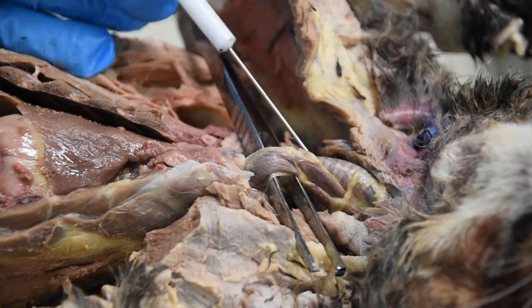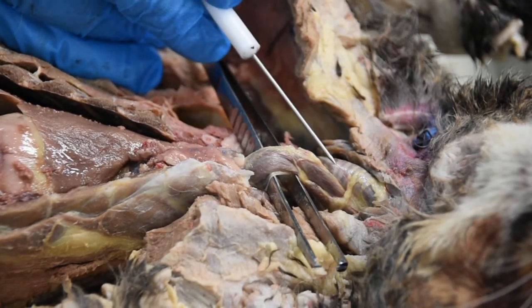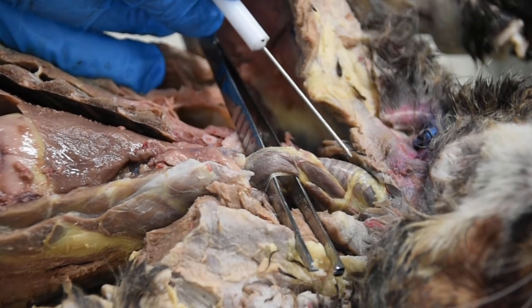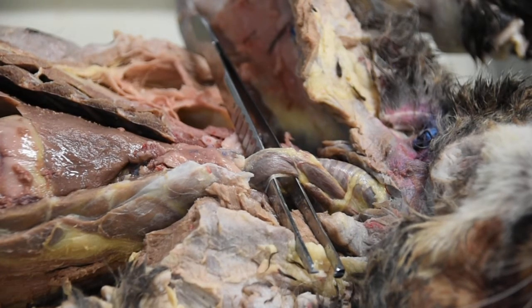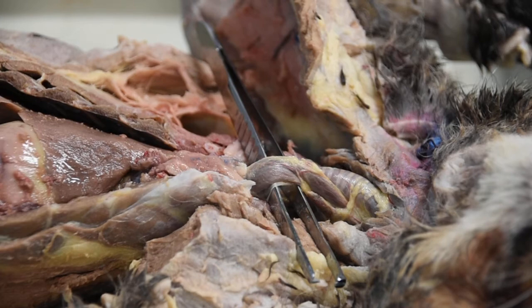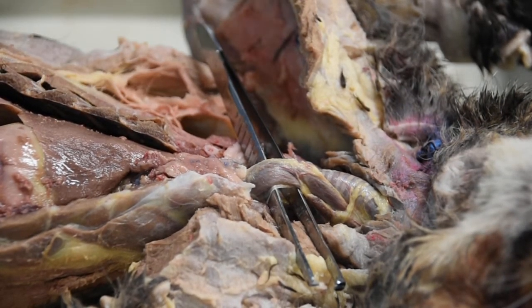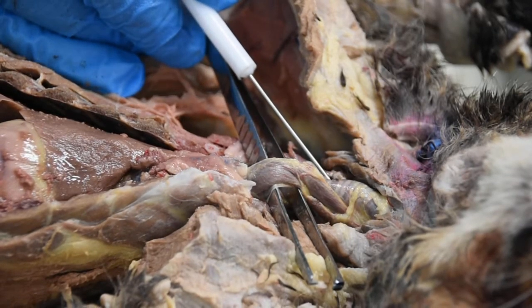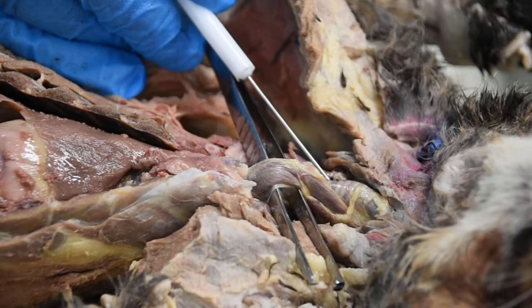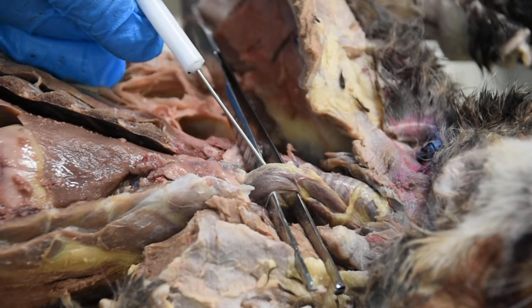Right here there's two tubes that you can see. The one that I'm pointing to right now has these white lines going through it. This should sound familiar to you because this is basically what you will see on your trachea, the same thing in humans, which keeps the air passageway open. So the tube that we're looking at here would be your trachea.